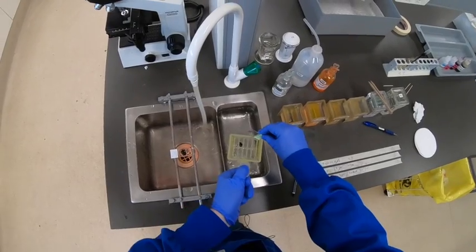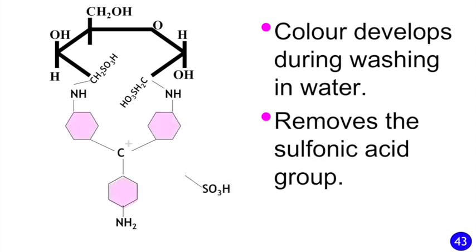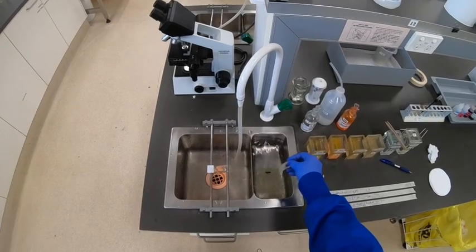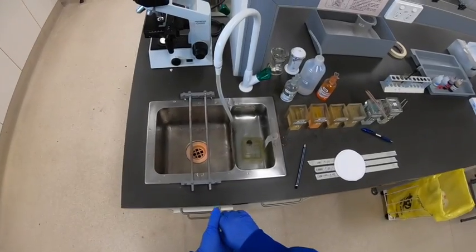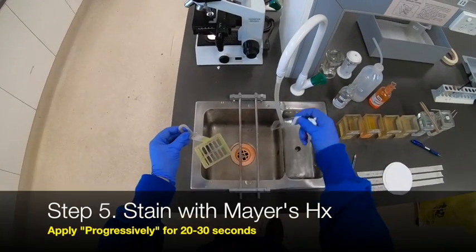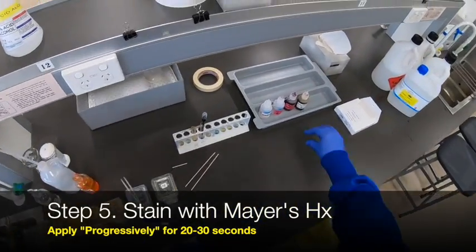The essential final step in the PAS staining procedure is to rinse those slides well in water. As shown in the animation, as the sulfonic acid group is released, that's what brings out the full color. You really should leave those slides rinsing — with the tap running like this or with some agitation — for at least a good five minutes. Once you've done that, even for something like kidney where it's essentially just basement membranes, you should be able to see some slight change in the color of the tissue.